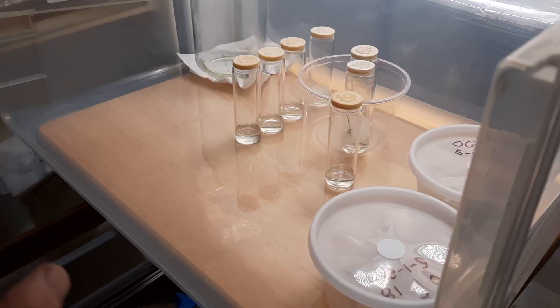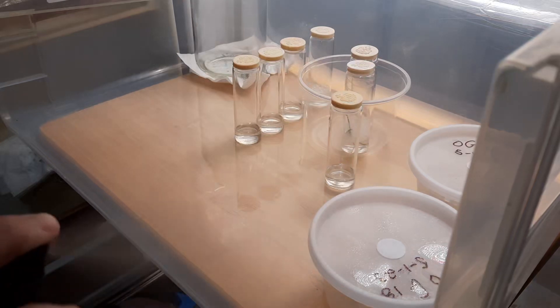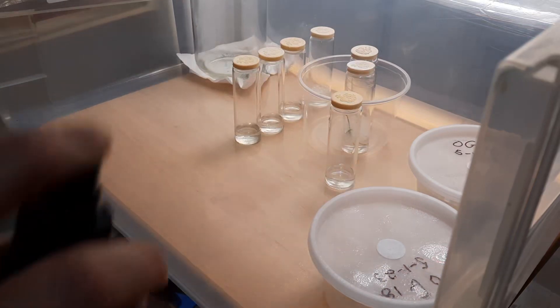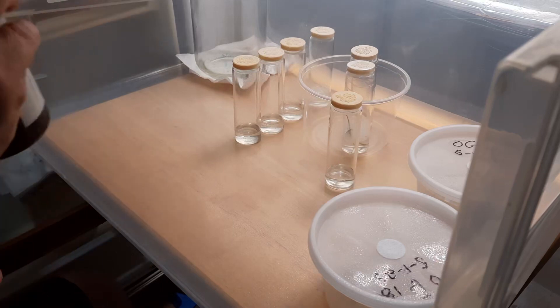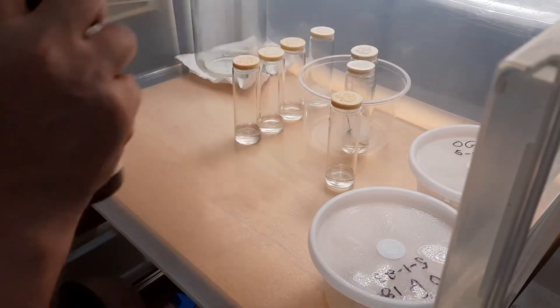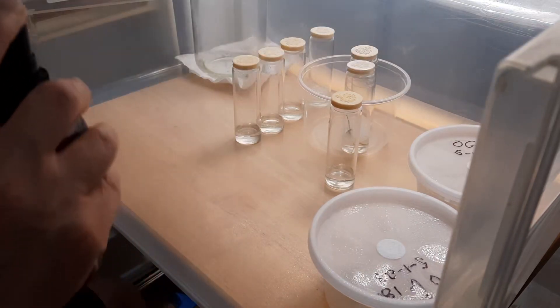Hey, what's up, grommies? Well, I found some contamination on some of my cuttings. I kind of went about this the wrong way, if you remember right. I'm not new to mushroom culture, but I am rusty, and I am brand new to plant tissue culture.